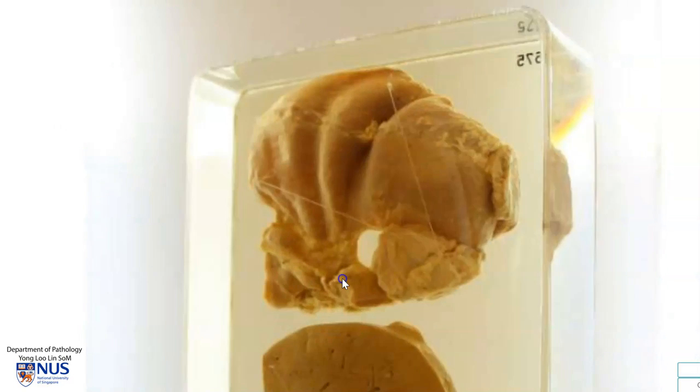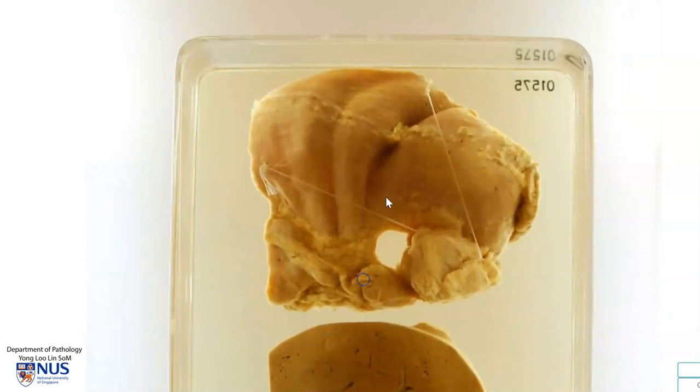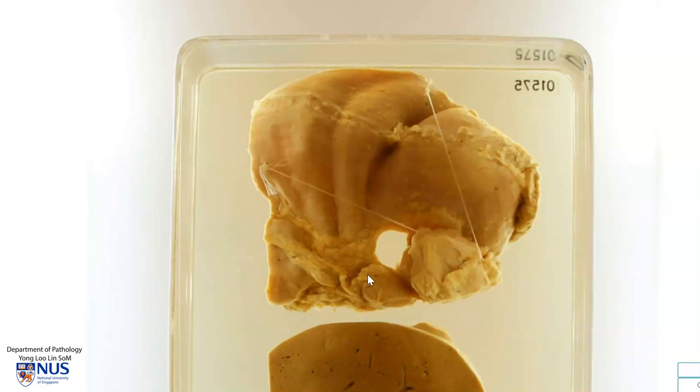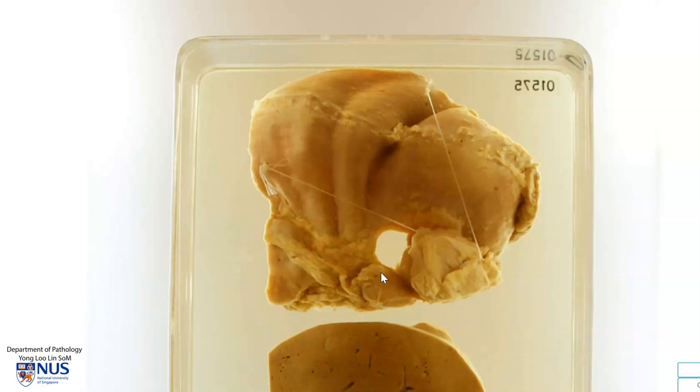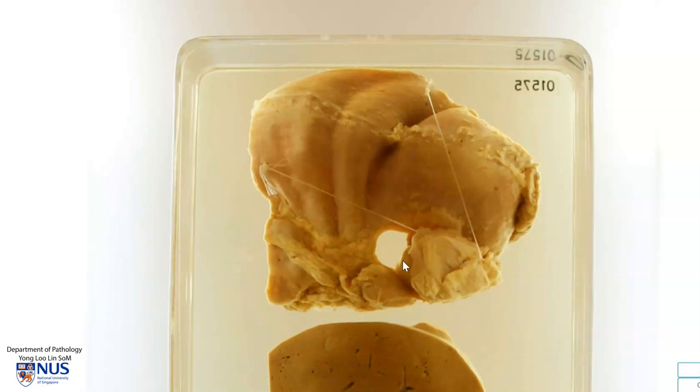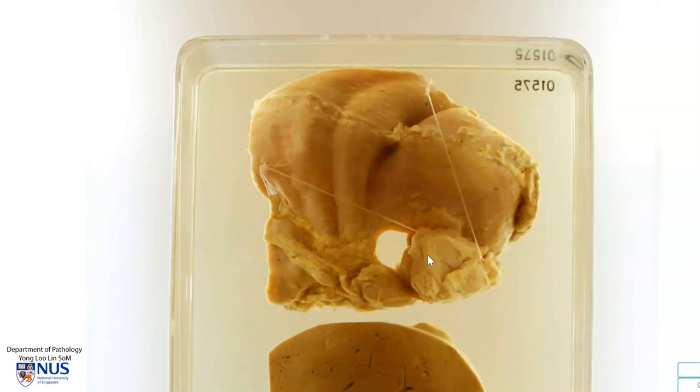Let's have a quick look at the serosal surface. So this is the serosal surface of the stomach, and this is the area that has been sampled for histologic examination.